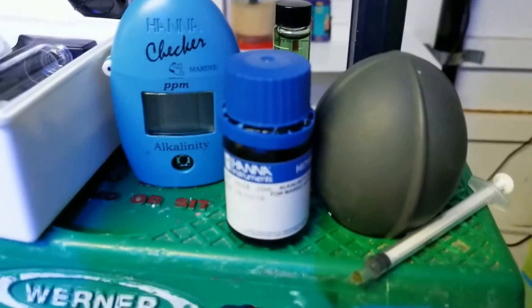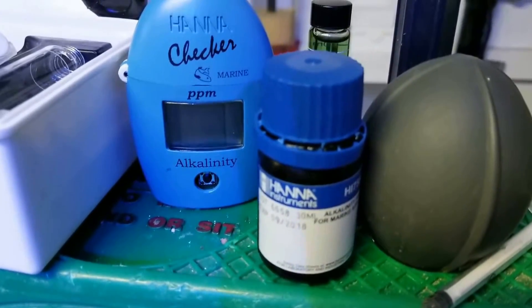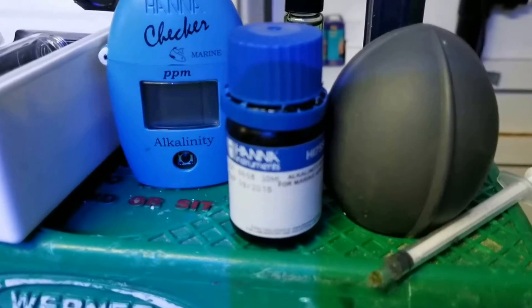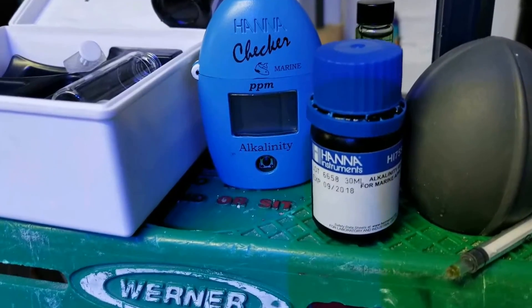I have to do a shout out to Corey — he brought this up first to me. Take the cardboard out of the cap, and also leave your bottles sitting up like this so they don't leak out. That should do the trick.